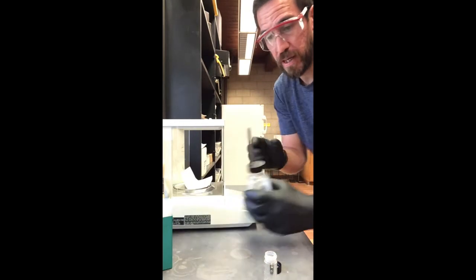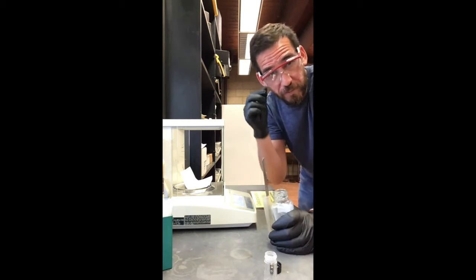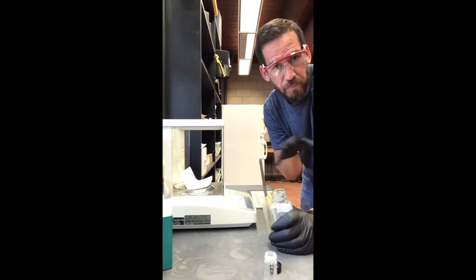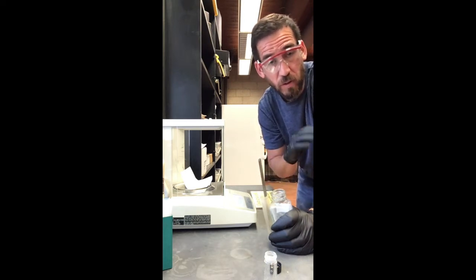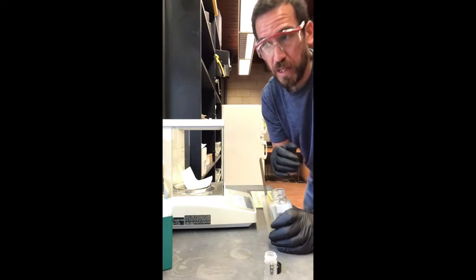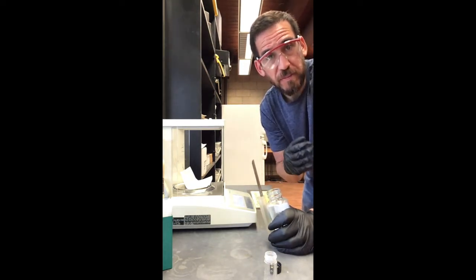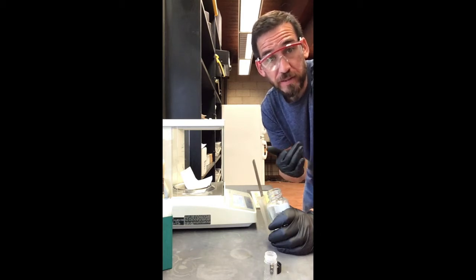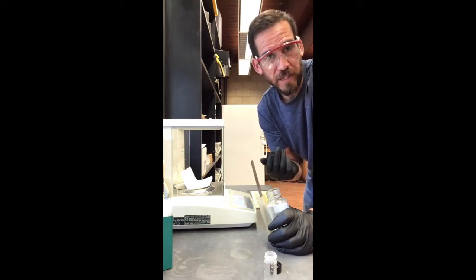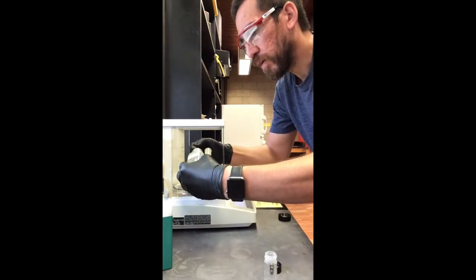We want 0.05 grams, which is also 50 milligrams. There's a setting on the scale to switch between grams and milligrams. Just as in part one, we don't need exactly 50 milligrams — we just need to record the exact amount. I'm going to get close to 50 milligrams but I don't want to spend five minutes weighing it out.